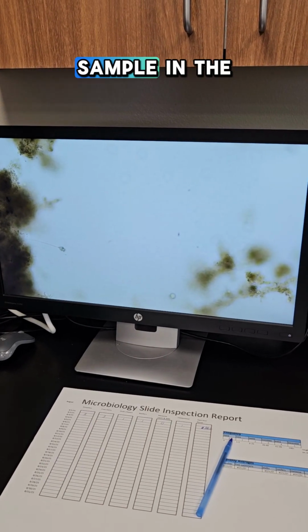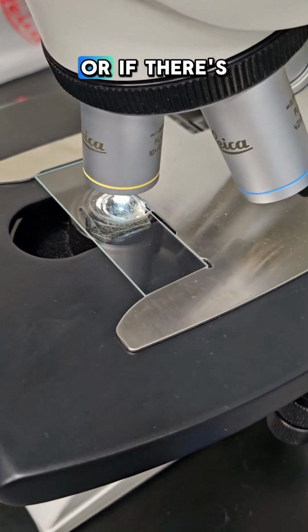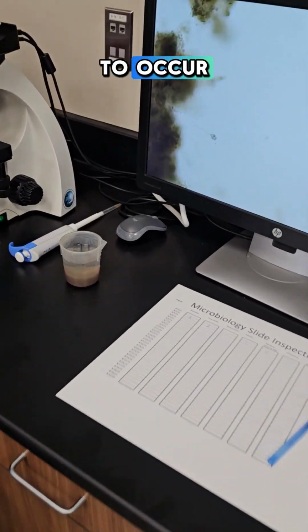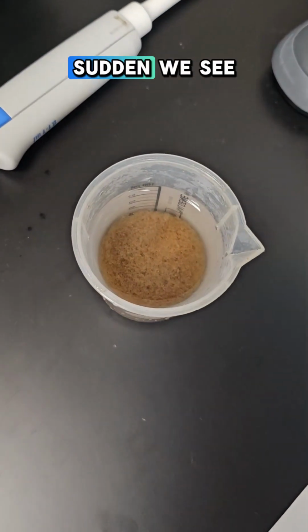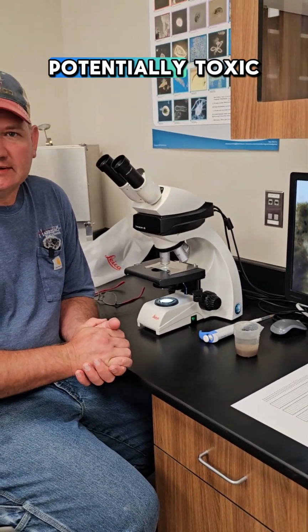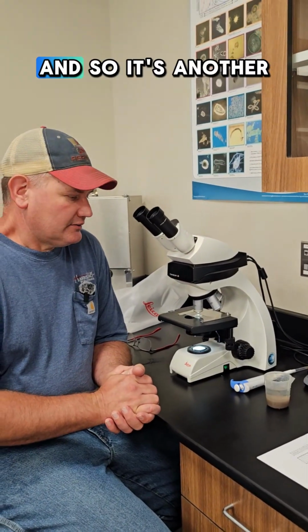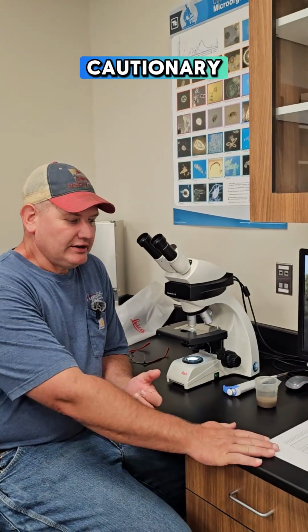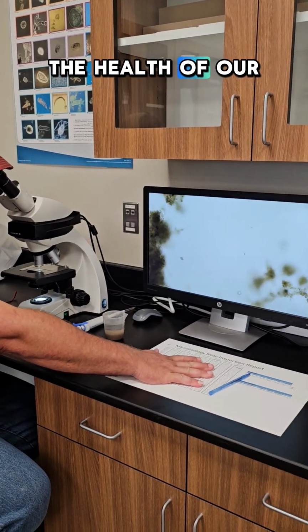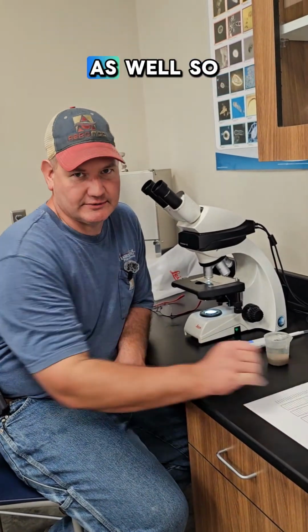But when we run a sample in the machine to see what a parameter is, like what the ammonia level is, that takes time for the reaction to occur. When we look at the microbiology, if all of a sudden we see everything is dead, that's a big concern, because that means something potentially toxic has come in and disrupted our microbiology, our biomass. And so it's another cautionary check to make sure everything is looking good and normal. In addition to determining the health of our sludge, we're checking for potential problems as well.